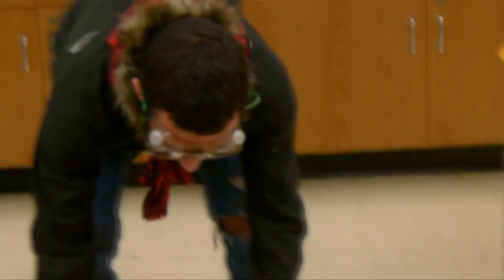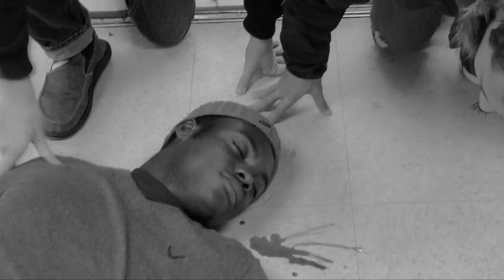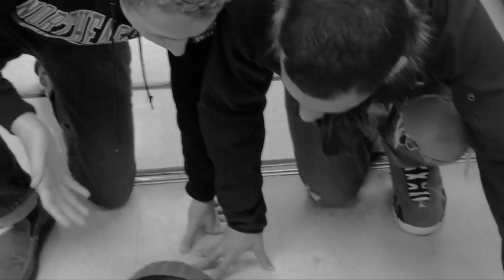Dude. Oh my god. Oh my god, Humphrey. Humphrey. Dude. Yo, did you call an ambulance? Yo, are you okay? Oh my god. Hey, Humphrey, can you hear me? Humphrey. Oh my god. He like threw that up.